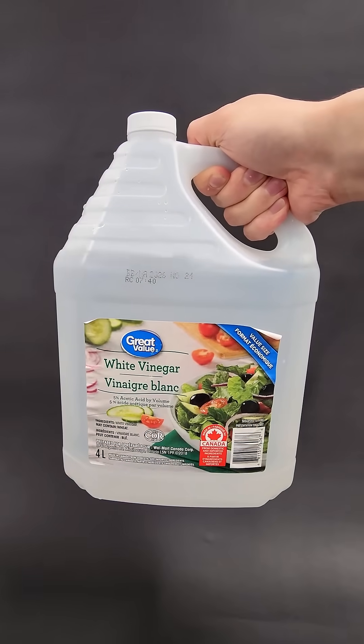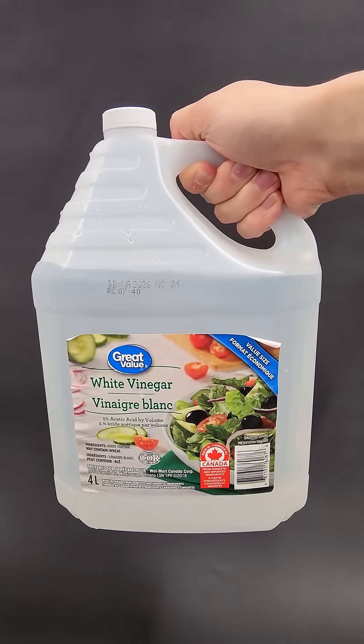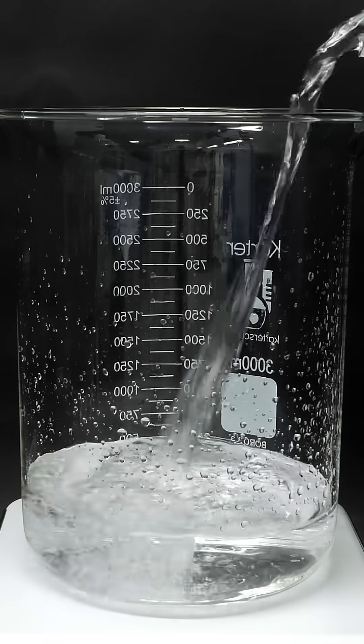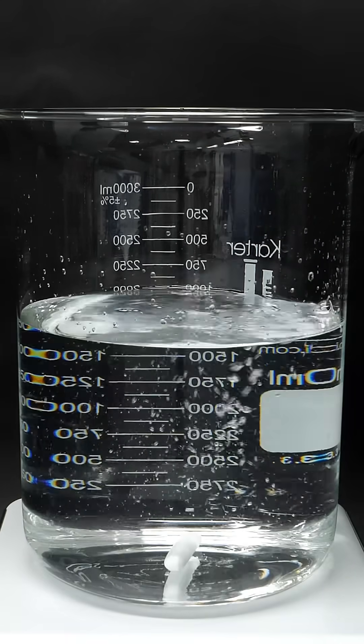This is just some regular vinegar, and I'm going to do something that I think is pretty fun. To get started, I just need to dump it into a large beaker, and I'll add about 2 liters.